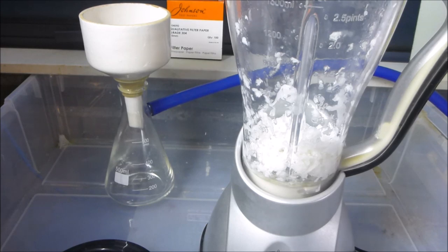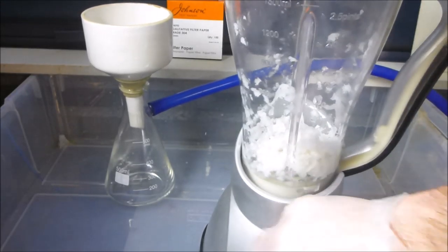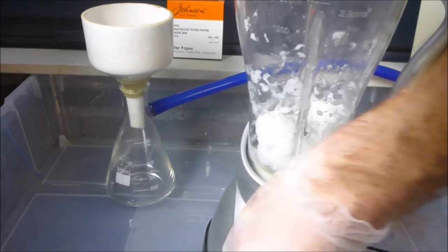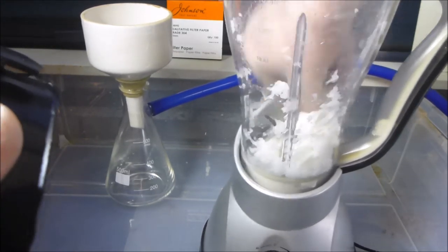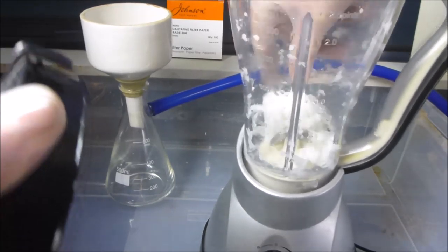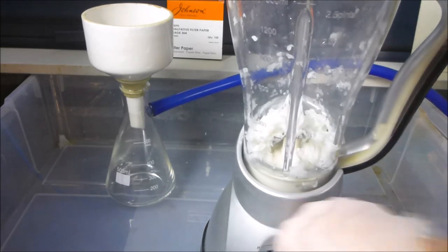Should be okay. And we'll do a little bit more blending. Unfortunately, it's getting poked out to the sides now too quickly. It's just getting thrown out, but that's feeling pretty good actually. We've got a pretty good consistency there. Let's just see if we can get a couple more blends into it.